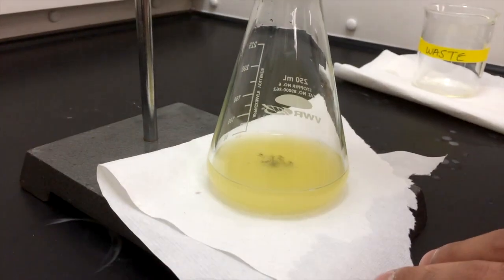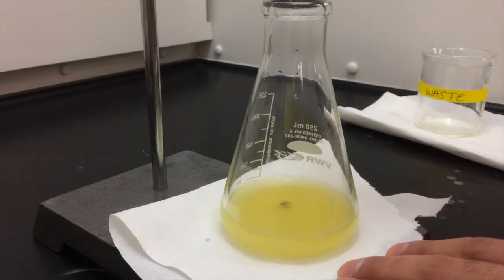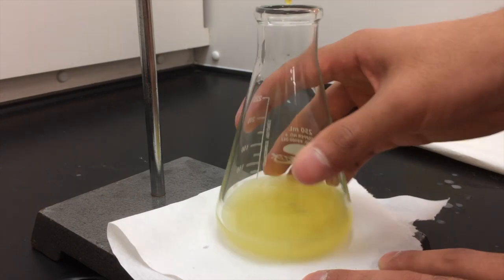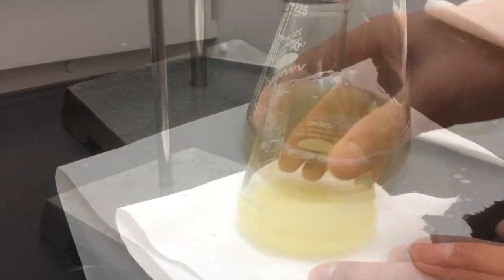From here, begin your titration. Add the iodine solution drop-wise to begin as you don't want to over-titrate your sample. Be sure to continuously stir in between the drops.